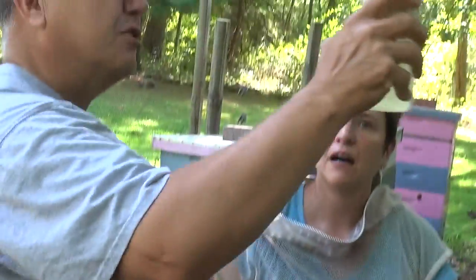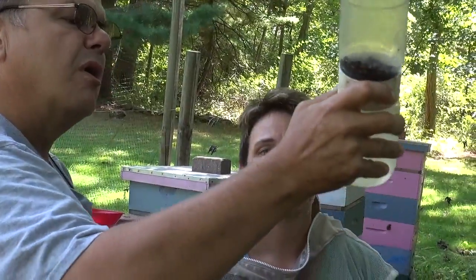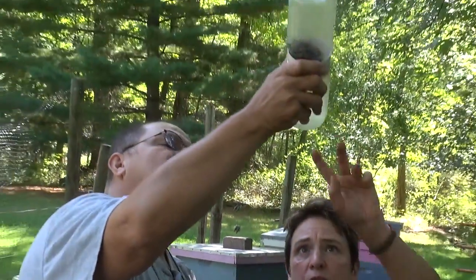At the very end I like to give it a swirl to help dislodge anything. There's one now — see that? We got it at the swirl.